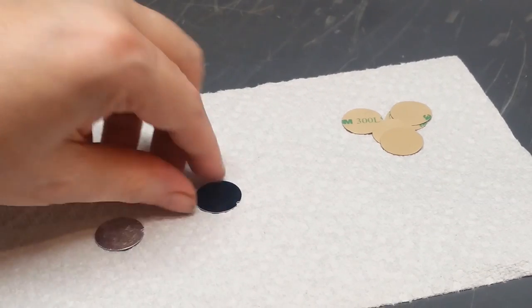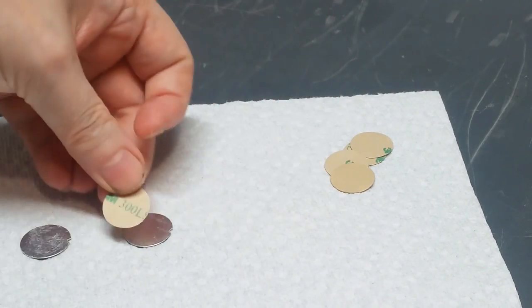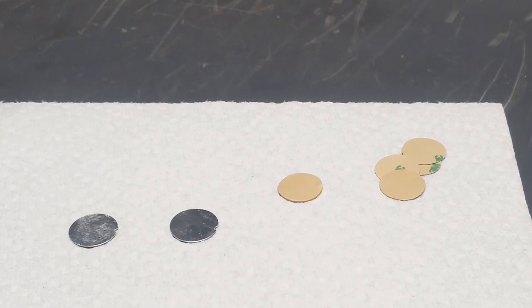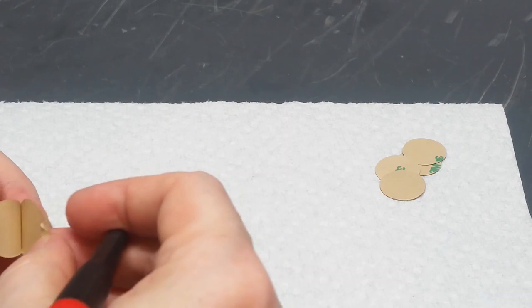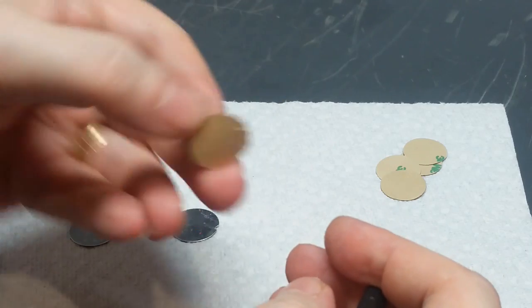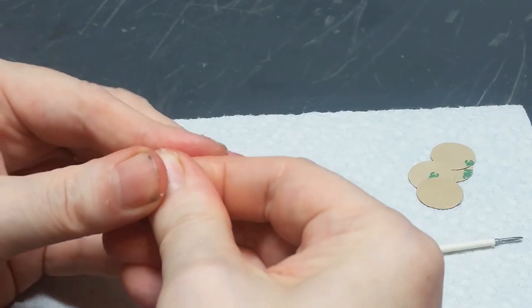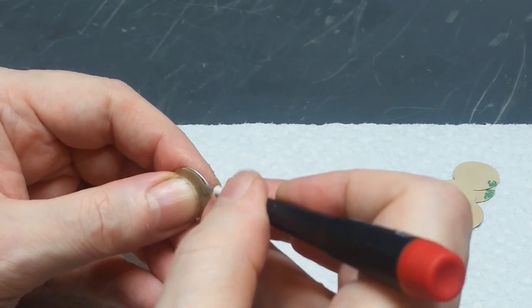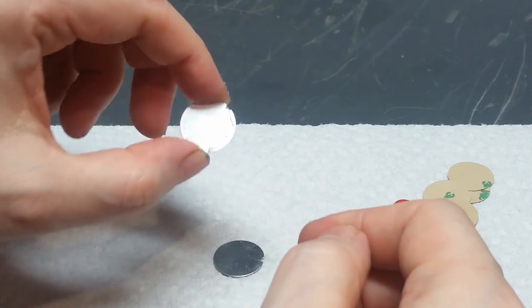Okay, I'm back. I've got these discs cleaned off pretty well on the backside. I've got some pre-punched 3M 300 LSE adhesive discs here. I'm going to use that adhesive to stick on here and reapply the knobs. Okay, to start with, I'm going to take one of these discs and I'm going to try to remove the cover, this protective film here. Is removed and this is the adhesive at this point. What I'm going to do is carefully line that up. Apply it to the disc, and now the tricky part is to peel off this without peeling the adhesive off the knob cap. So there's adhesive on that, so that one's ready to go.